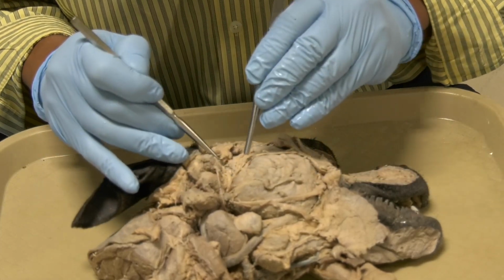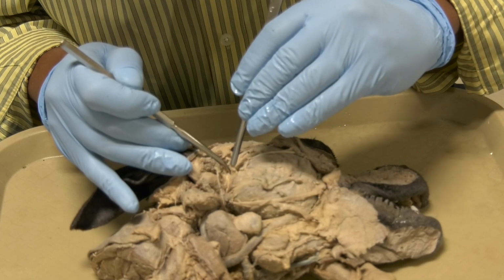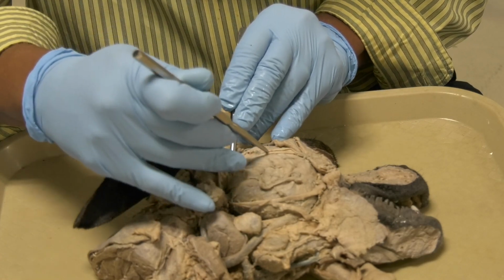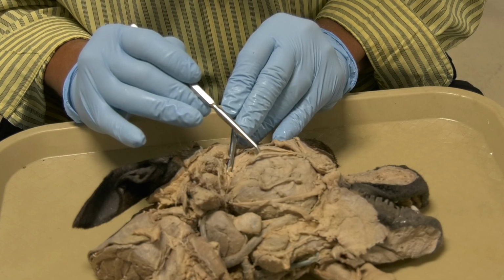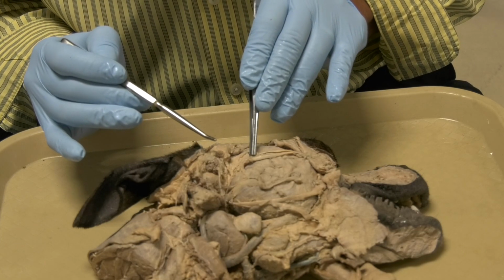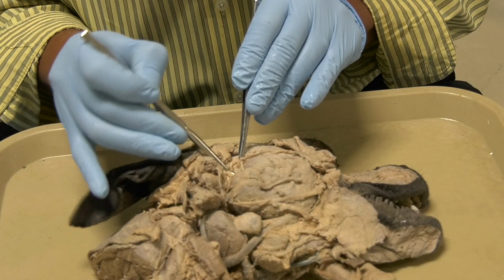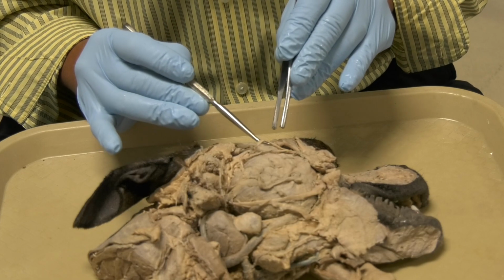This nerve here, this is the auriculotemporal nerve, which is coming from the mandibular, okay, and it will give these branches, okay, they run in close proximity to the dorsal buccal, but this is from the facial, and this is the auriculotemporal coming from the mandibular. The mandibular is coming in close proximity to the facial if you look at the origin of the mandibular here.